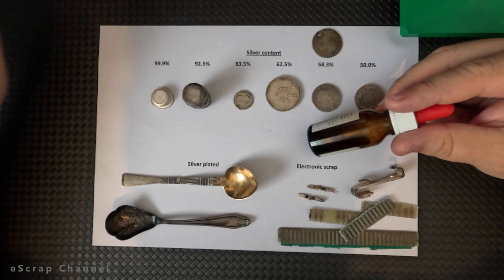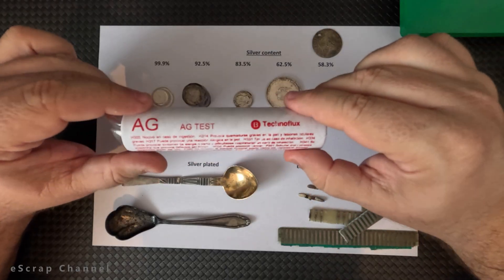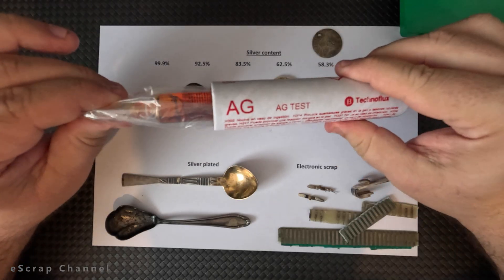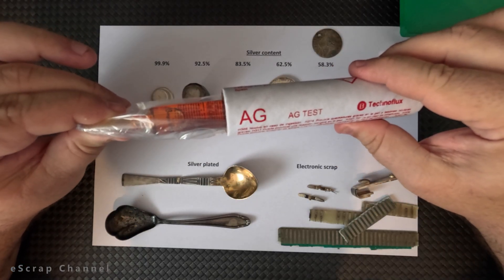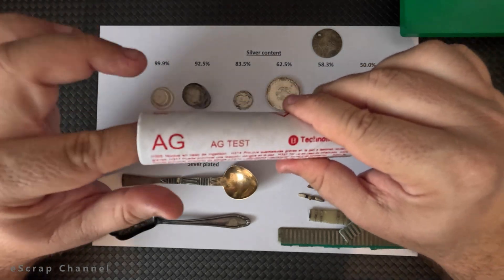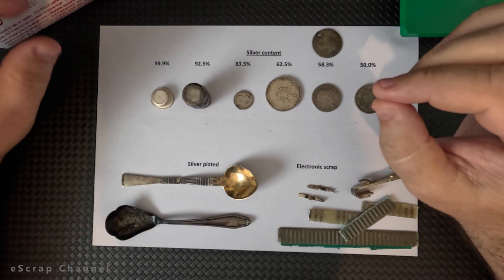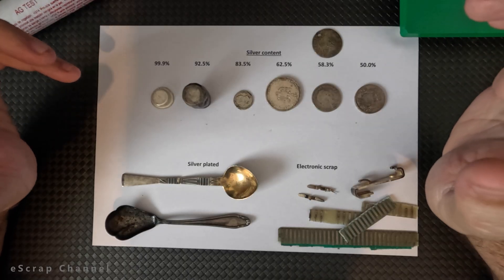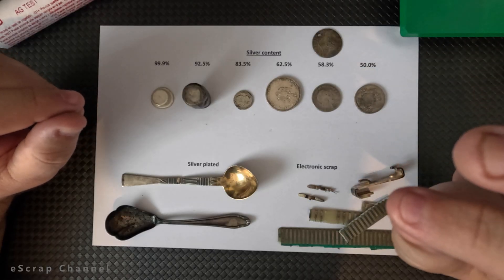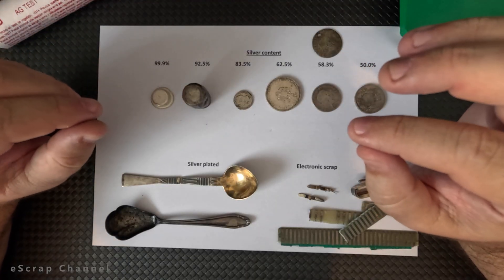What is the silver testing solution? Silver testing solution can be bought as a commercial product. This paper tube contains a solution of potassium dichromate, nitric acid and distilled water. When a drop of this solution is put on a silver object, nitric acid attacks the silver object, so silver goes into solution. It reacts with potassium dichromate and you see a very distinguishable and specific red color that indicates the presence of silver.